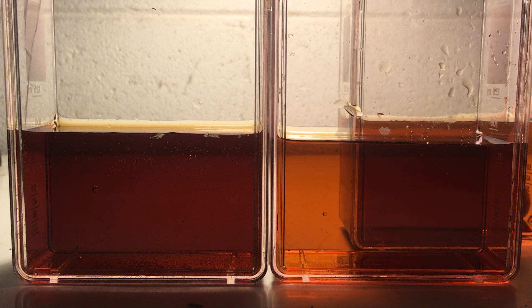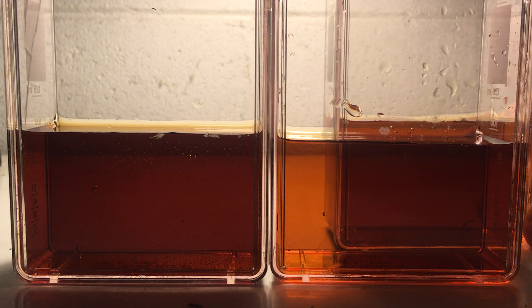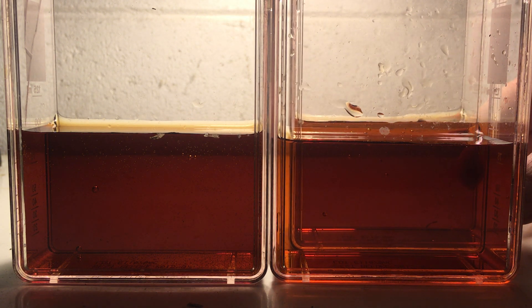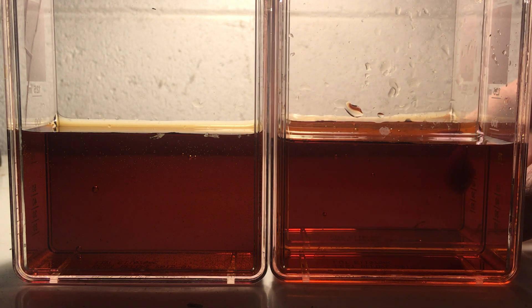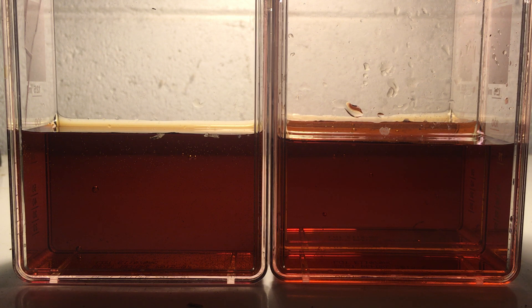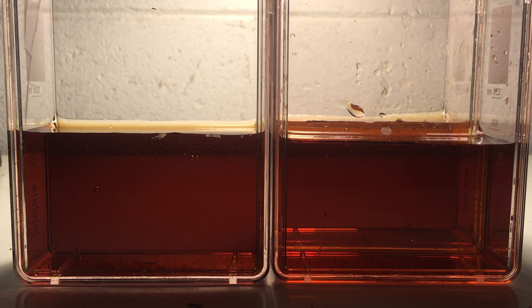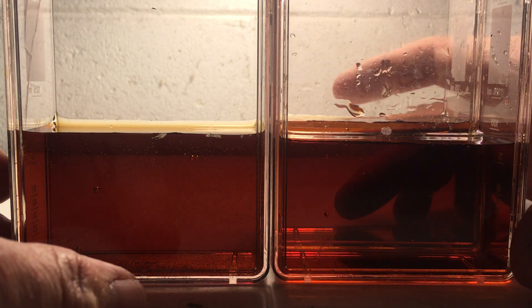you can see that as I move this cell in — when I put one cell behind the other — I've effectively doubled the path length. And when I double the path length, I've increased the light absorption from that diluted root beer solution. And so when I stack two cells one behind each other, you can see that the light absorption of both solutions is pretty much the same.